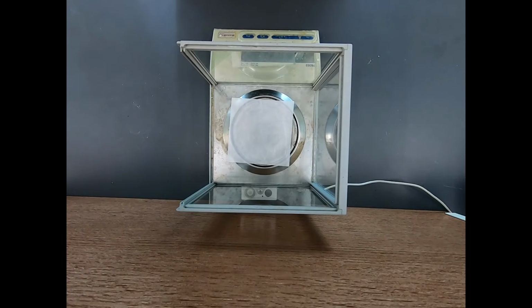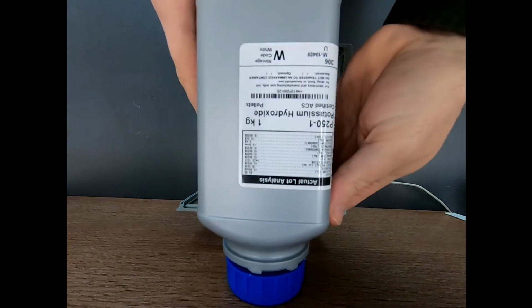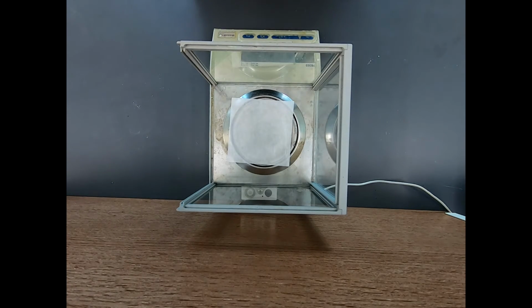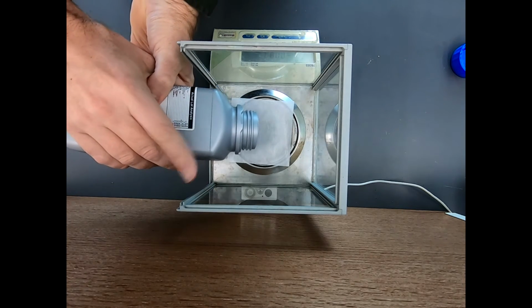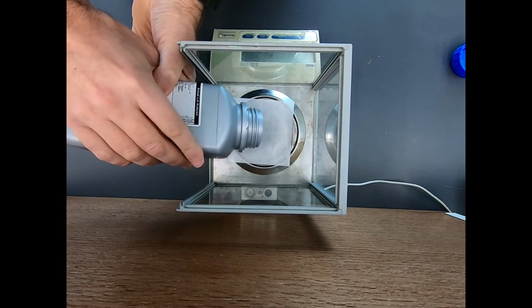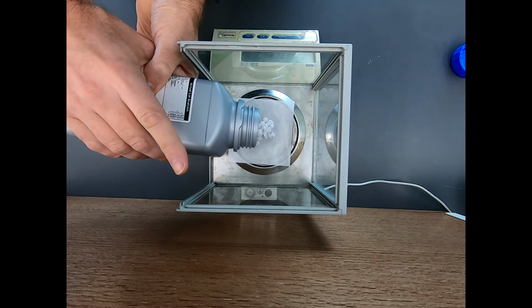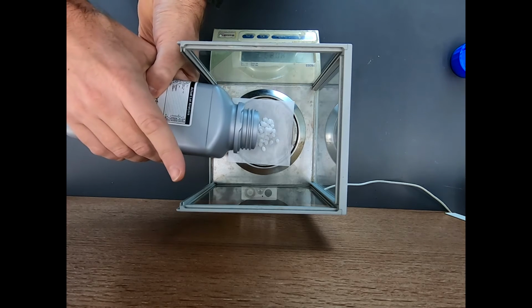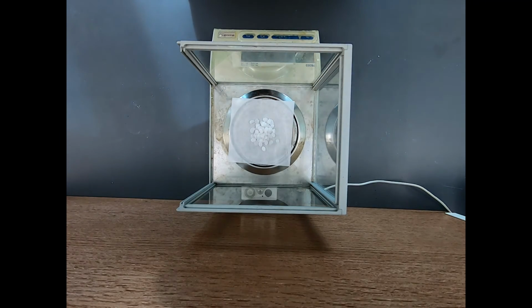Well, let's start weighing out all of our materials, and we are going to weigh everything at the balance. So the first thing we're going to start with is some potassium hydroxide. These are pellets. Now I want to get about 5 grams of these pellets, and this doesn't need to be exceptionally exact, so I'm just going to tap them out. 3.2, 4.0, that's overshot. Okay, that's overshot to 6.1 grams.